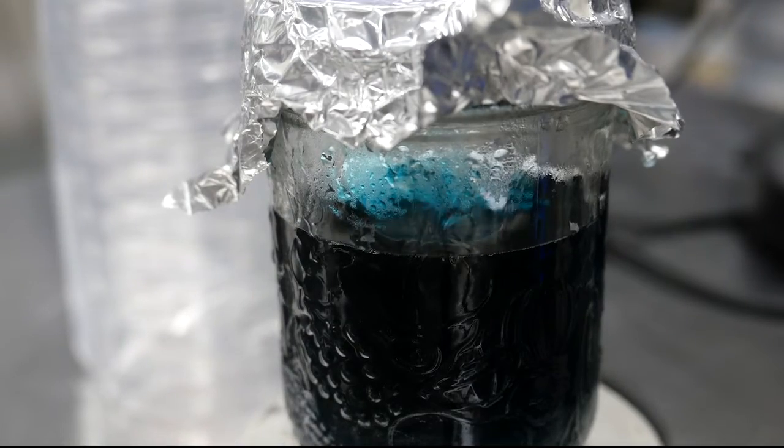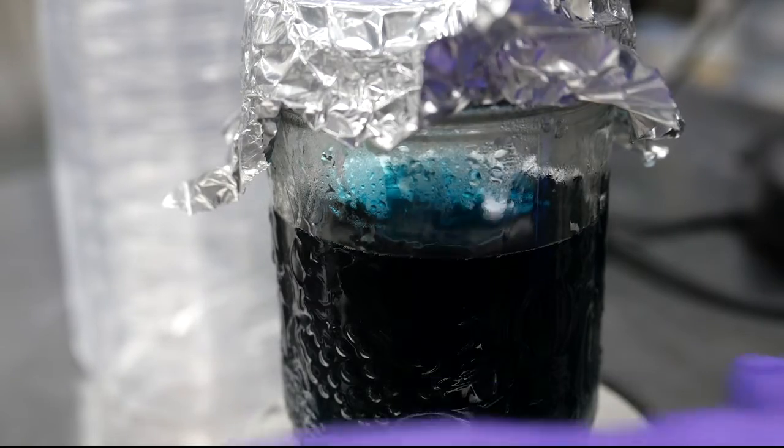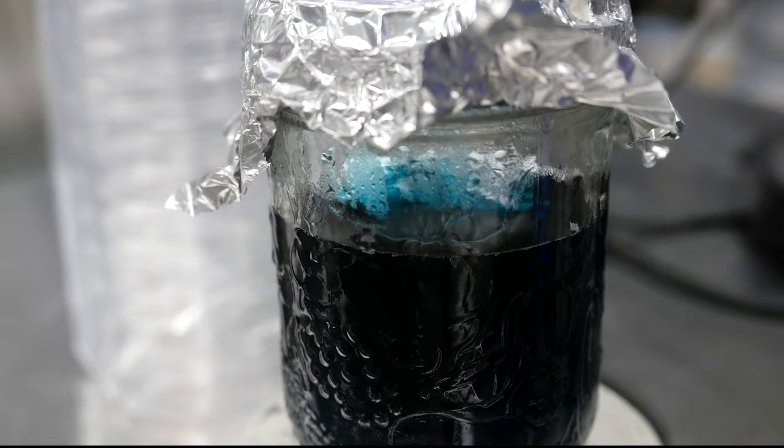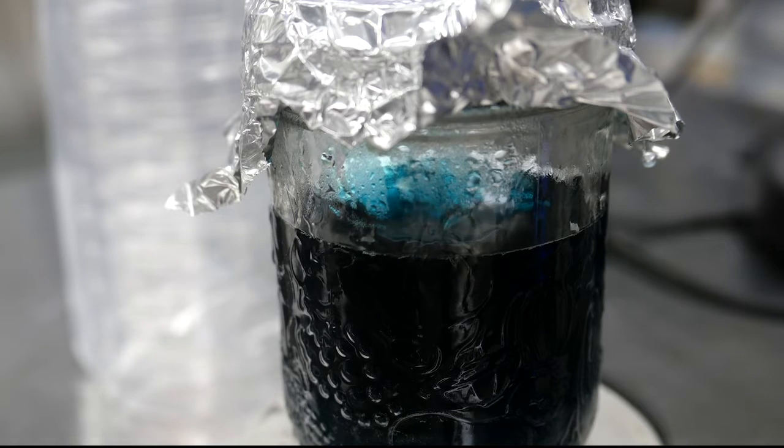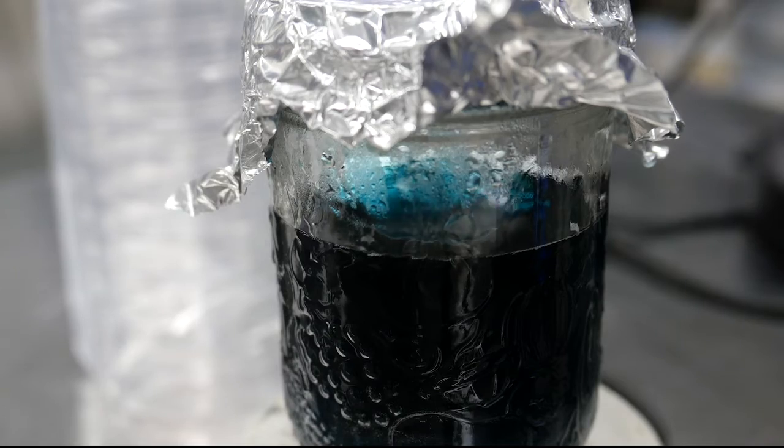Now we want that to keep stirring probably for about 10 to 15 minutes. We want it to cool down to the point where it's safe for us to touch. We need to be able to lift up that jar of agar. Typically that's when it's in about the 50 Celsius range.